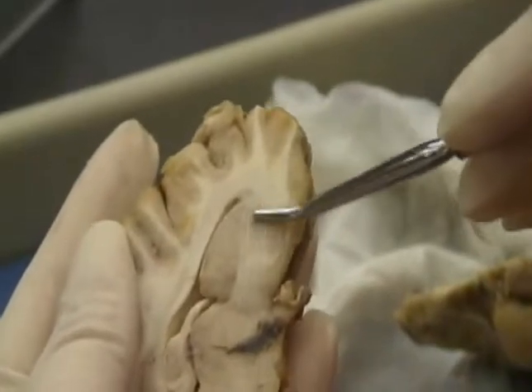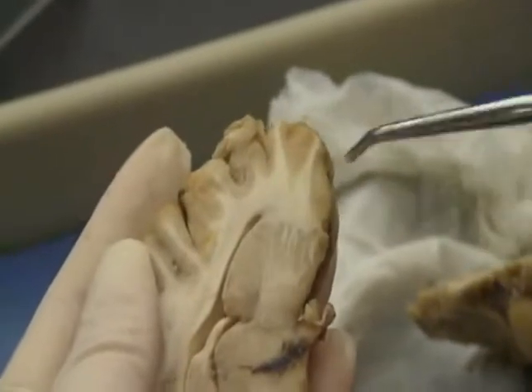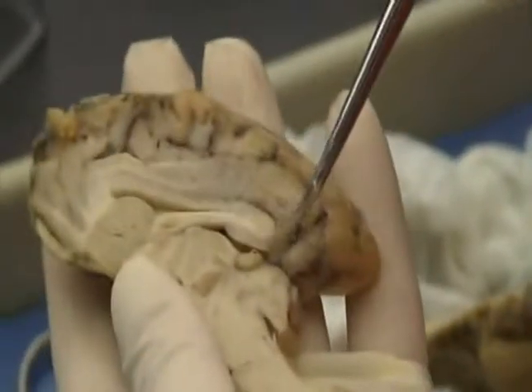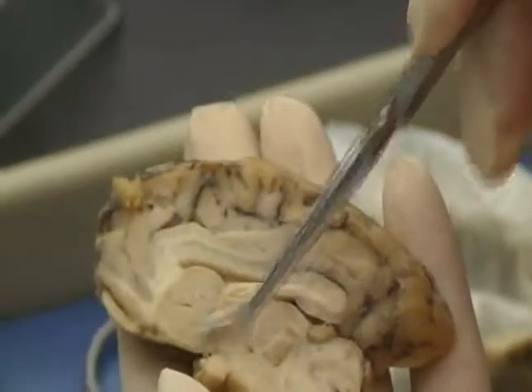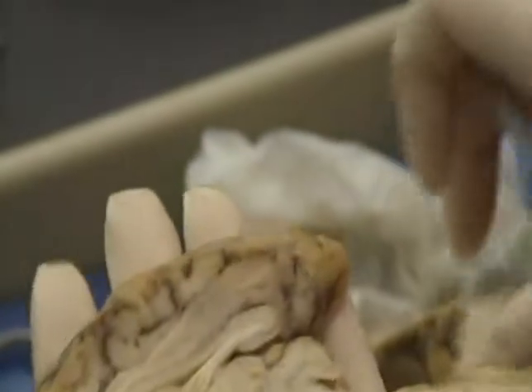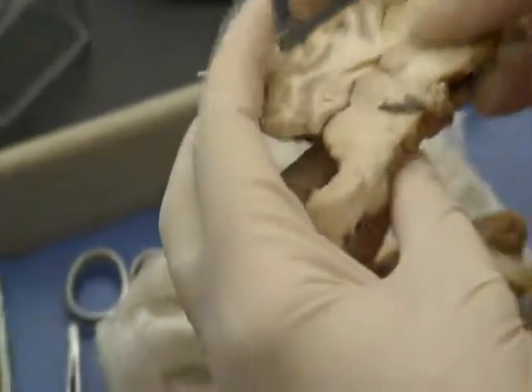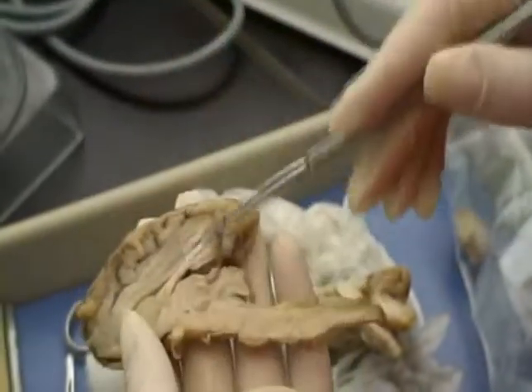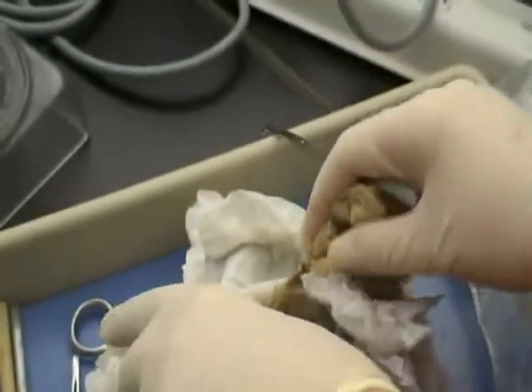Basal ganglia right here, the dark matter inside of the white, and typically they'll have these white stripes through them. Oh, that's where it is. The fornix is right here. It goes from the hypothalamus right here back into the hippocampus back there. The intermediate mass of the thalamus is what you see in a mid-sagittal section. You can see part of the thalamus back right here on the inside too. The third ventricle, again, is between the two halves of the thalamus in the mid-sagittal section. The fourth ventricle is back here.